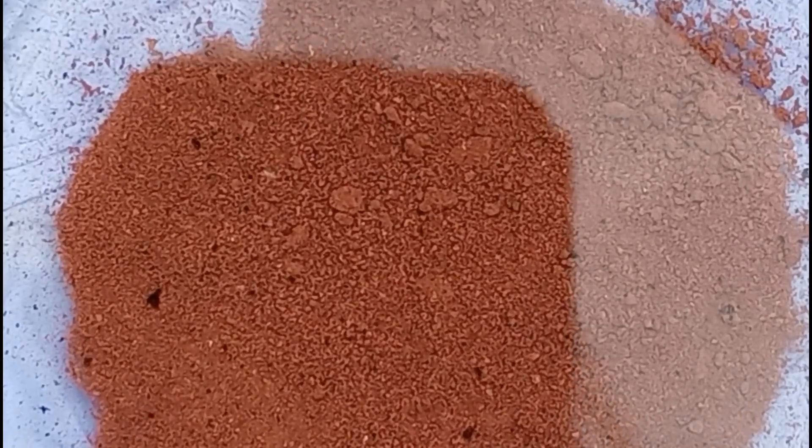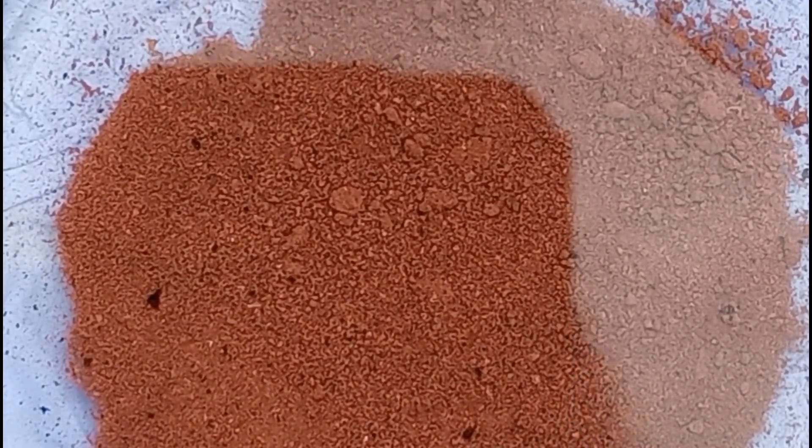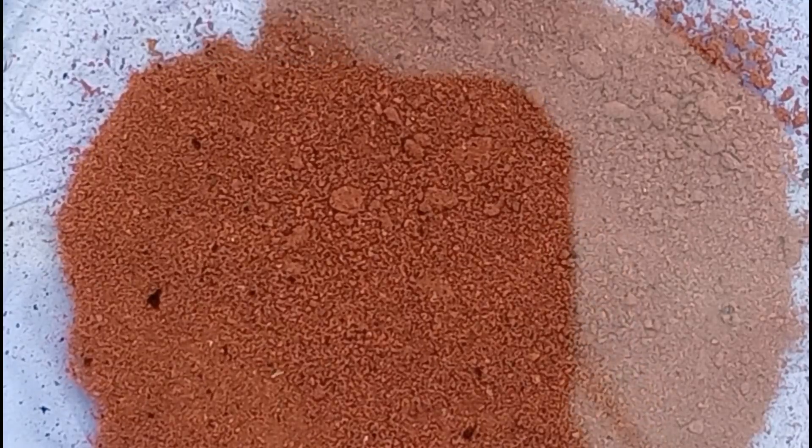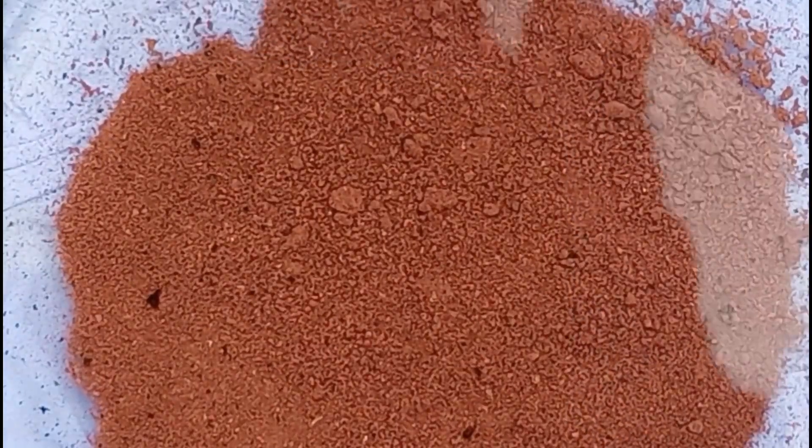The copper substance, on the other hand, was showing no reaction, although there were visibly less black specks in it.